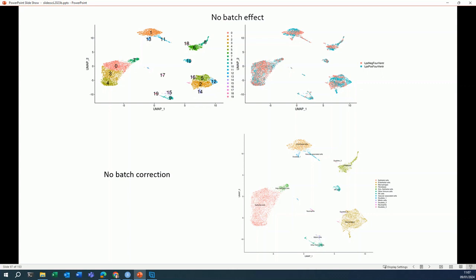I will show you a few examples. Sometimes you are in this case: you think about the setup of your study and you see no reasons for having batch effects. You make your UMAP and you don't see any batch effects at all. So the two samples behave very similarly. There's no shift between the two colors. There are no clusters that consist solely of one particular sample, so we don't see any batch effects here. So when this is the case, don't do a batch correction.